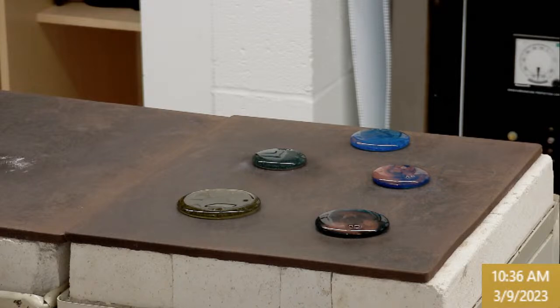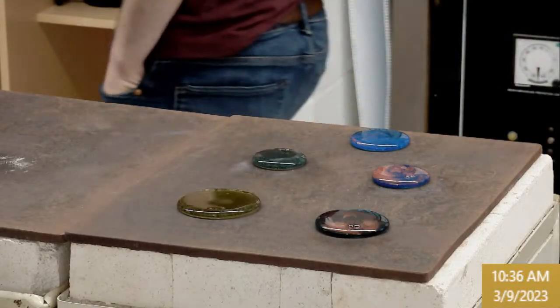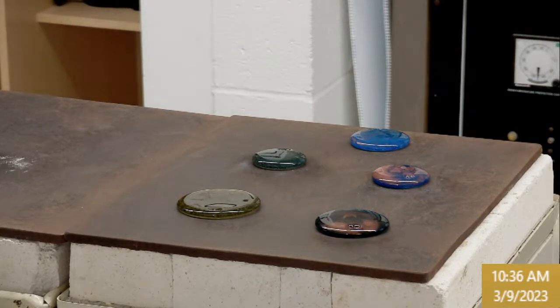So that's useful. You can analyze injection molded plastics. You can see all kinds of wild patterns here. And so what we'll do is go ahead and move your glass up here to the light table, and then you can see your internal stress fields and do your measurements.